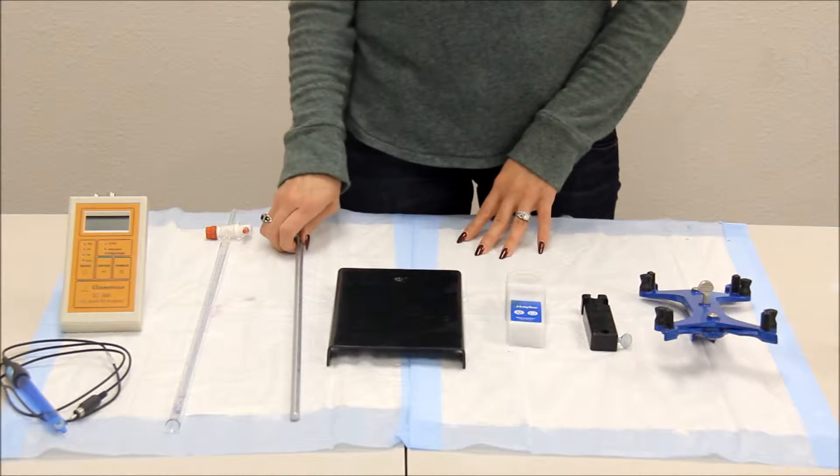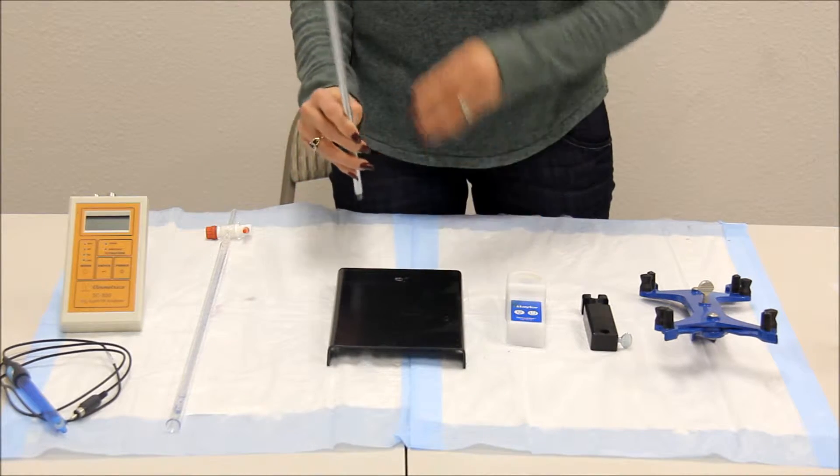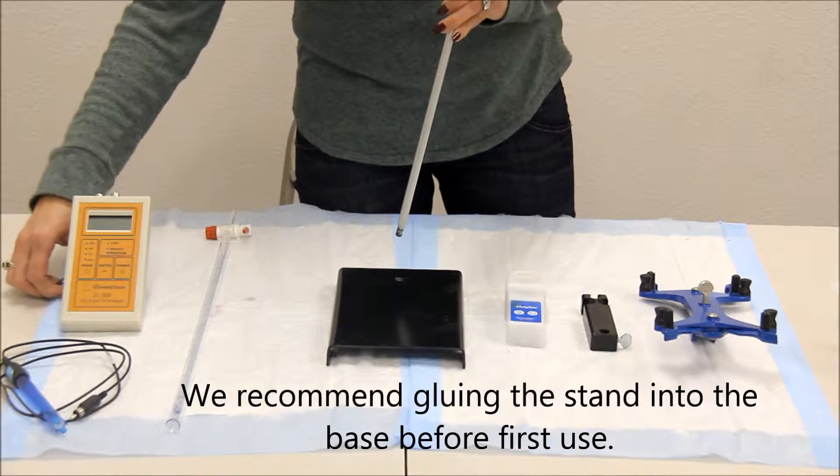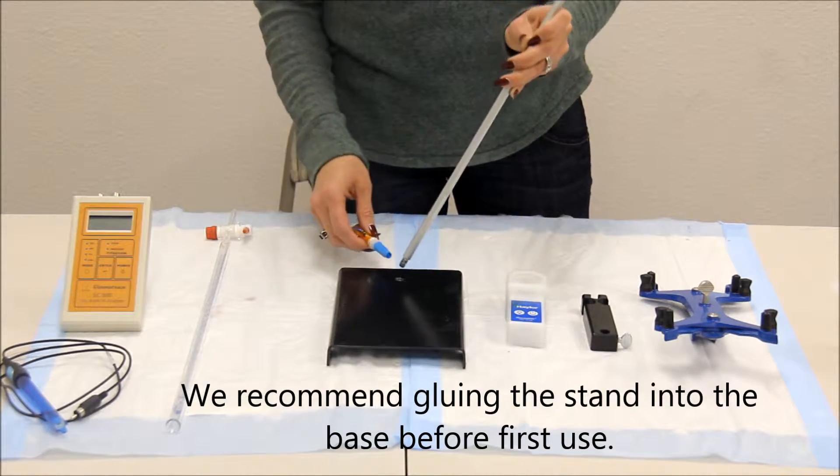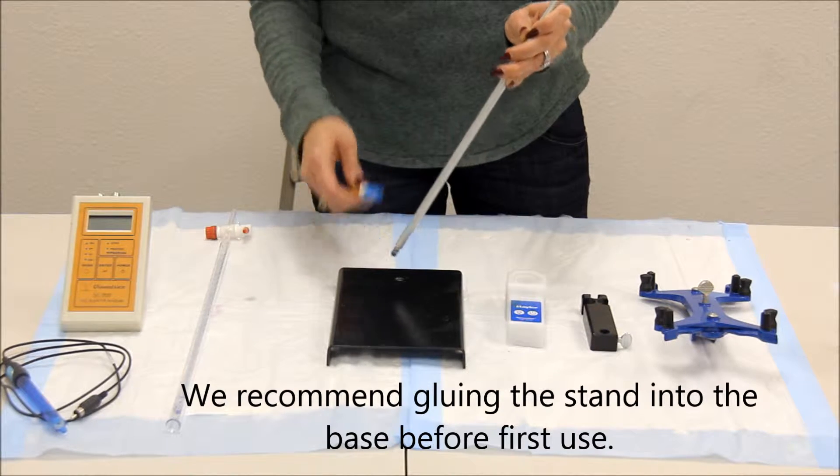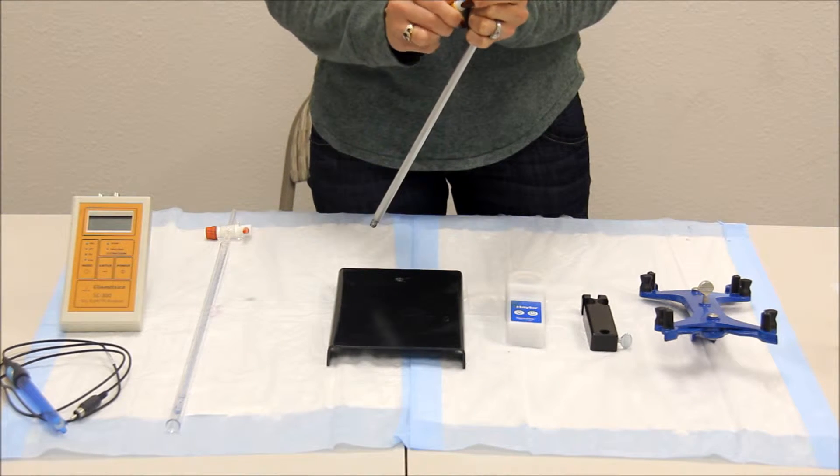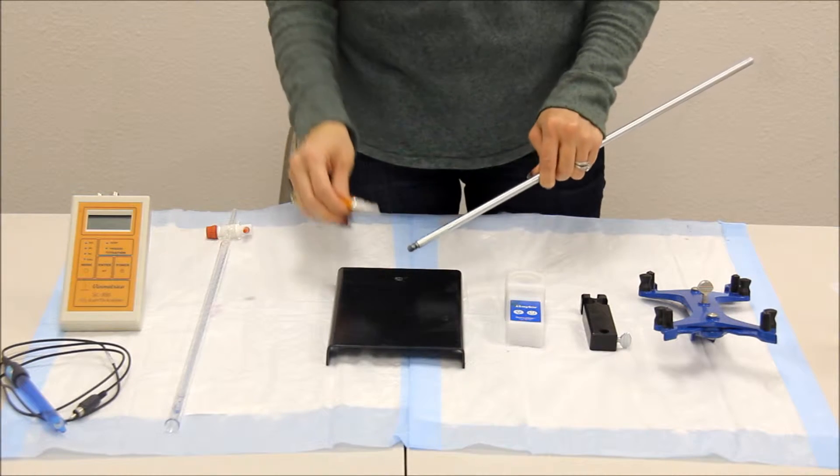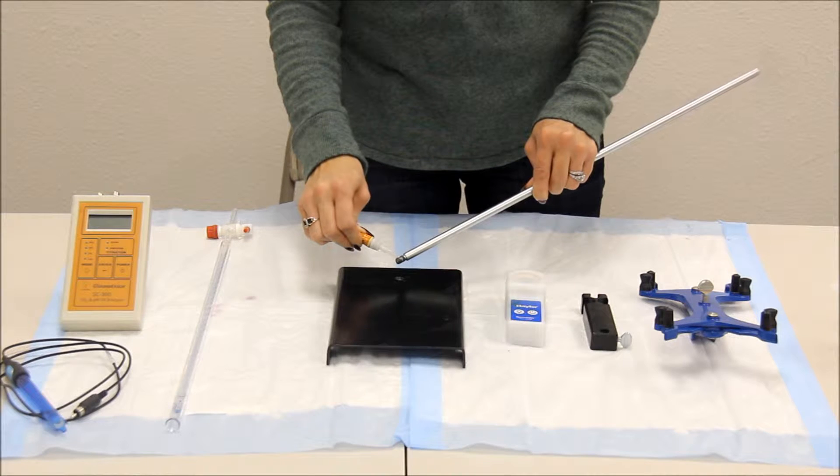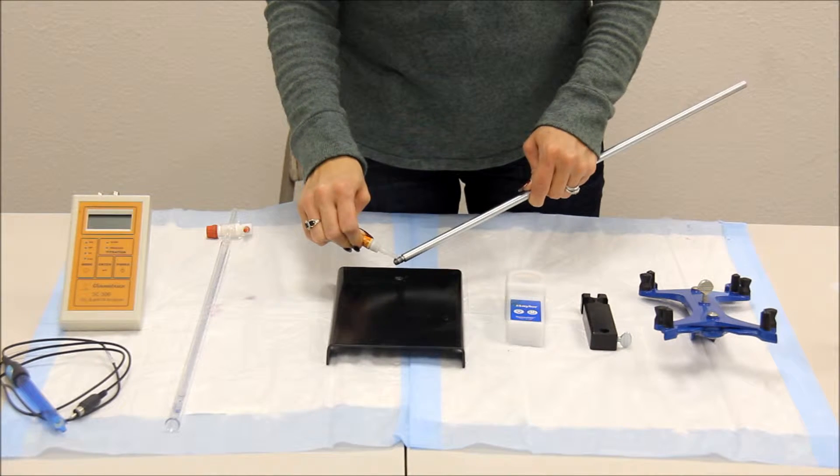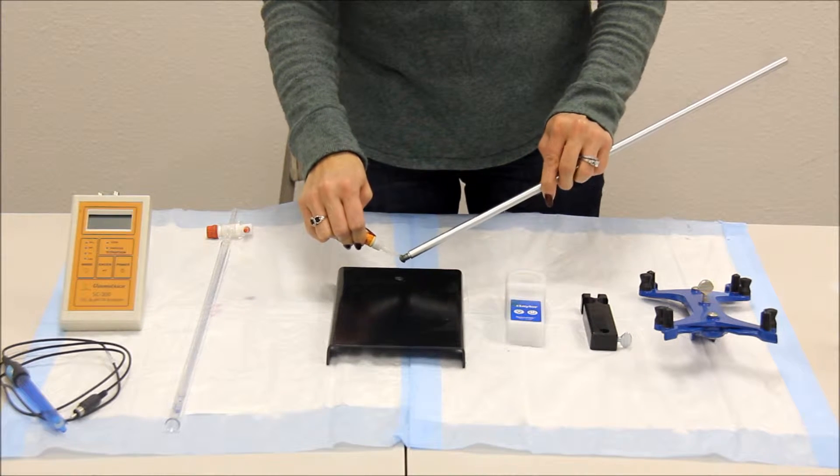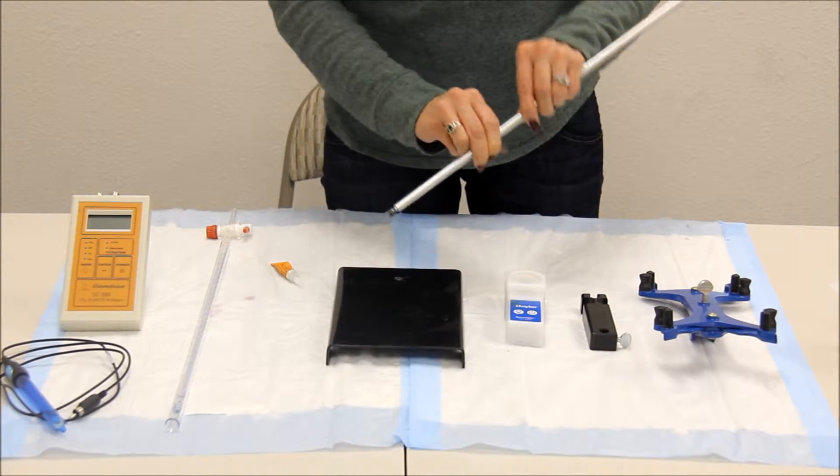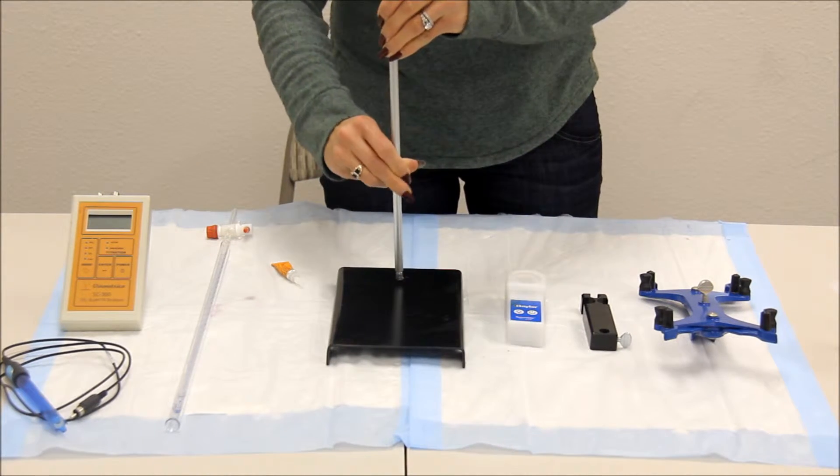Your first step will be to screw in the stand to the base. We will screw it in for the first time. Place glue at the tip and screw in.